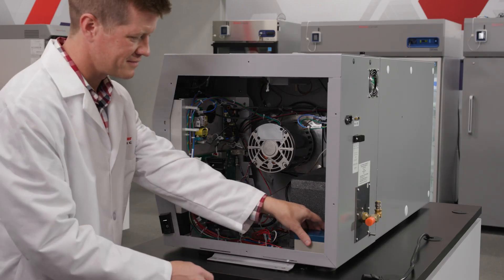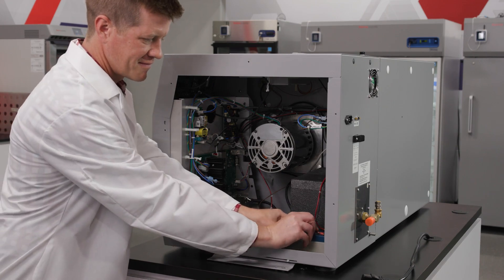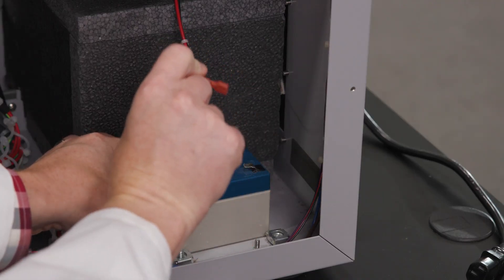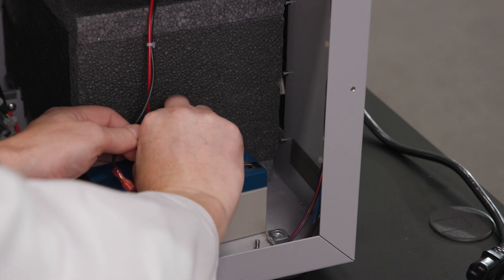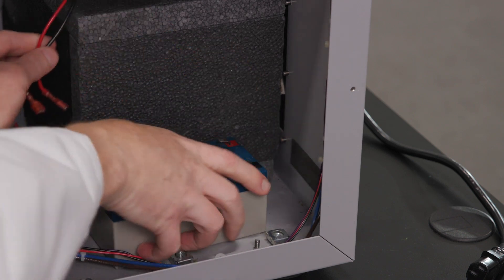Before taking the battery out of the unit, make sure to remove the wires connecting each terminal. Make sure to remove the negative black wire first, followed by removing the positive red wire.